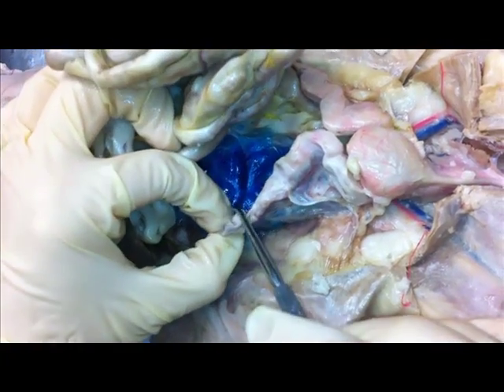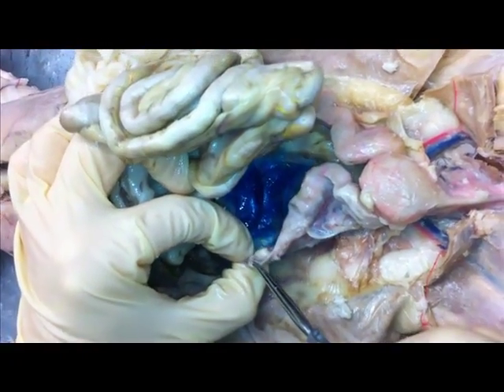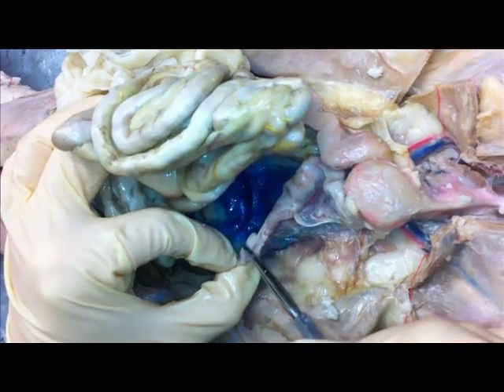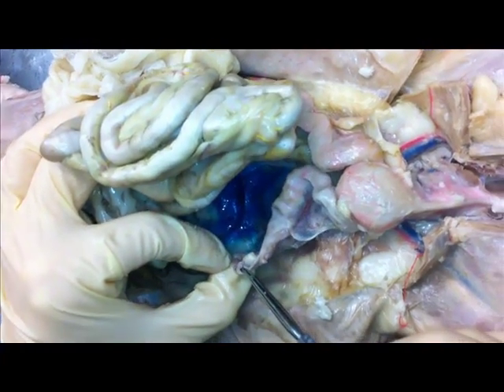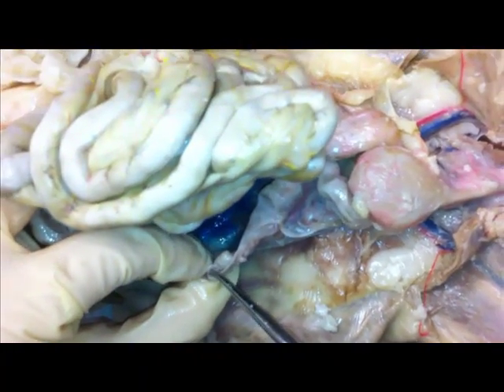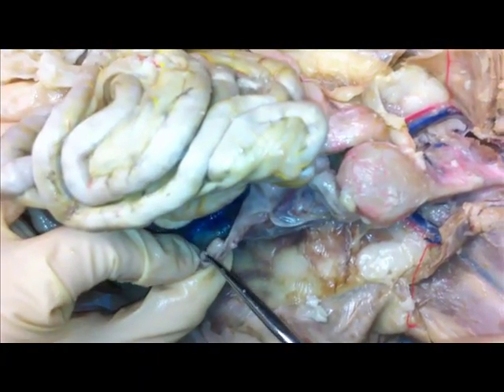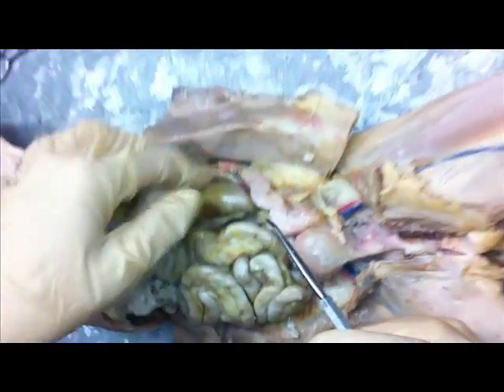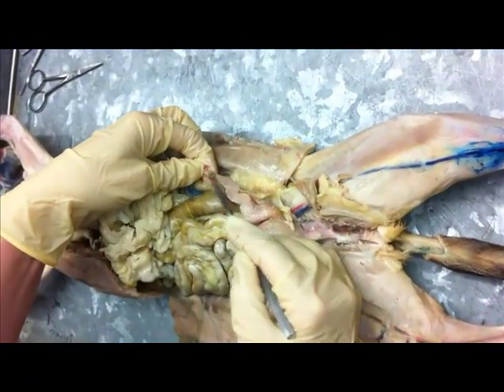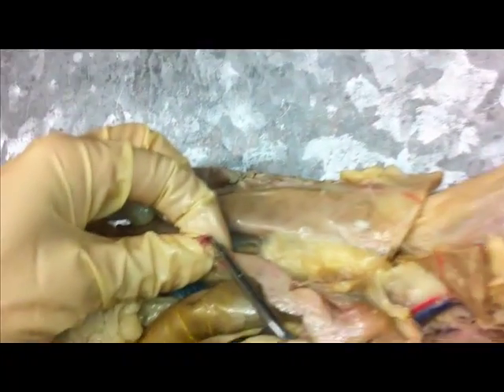Sometimes you can even see fimbriae on the end of it, if you're lucky. I'm having a hard time pulling that up right now, but the fimbriae can sometimes be seen over here — this would be the fimbriae right here.